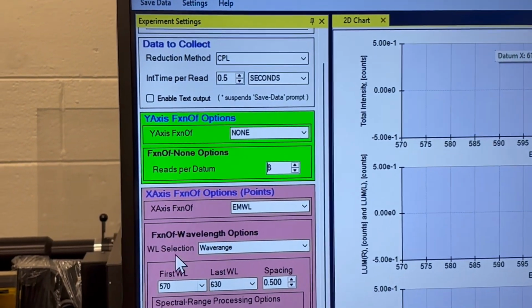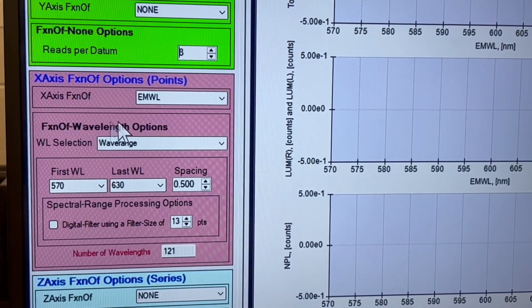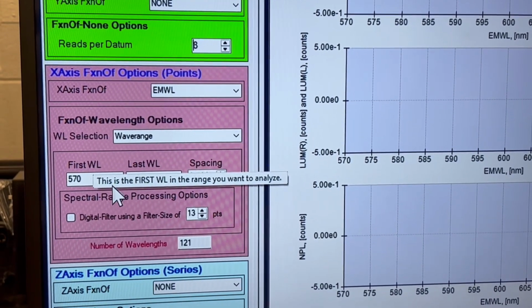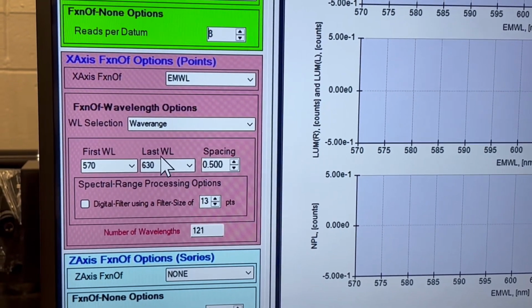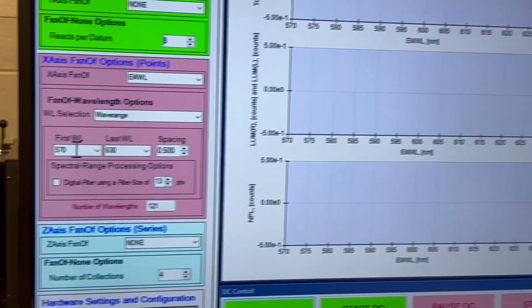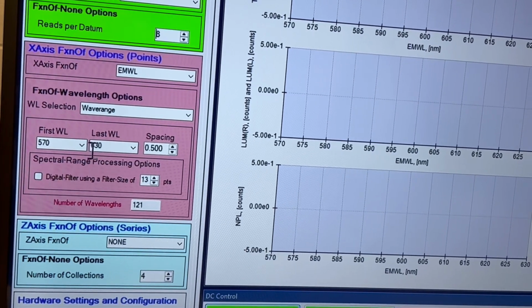Now, down further, we're doing the wavelength options, and I've asked it here, the first wavelength on the left, I said is 570 nanometers, and the last one is 630. That was chosen because that's where most of the activity one sees for the europium is, although going from 500 up to 700 uncovers several small peaks.